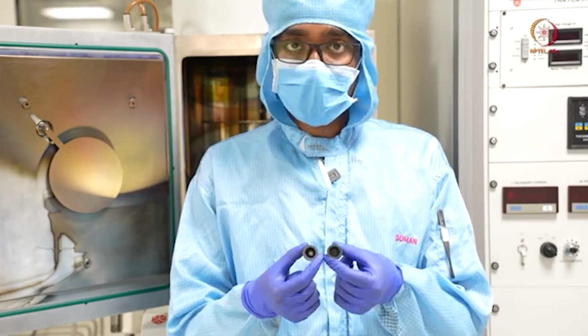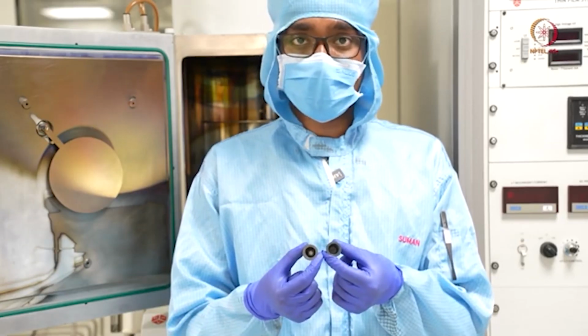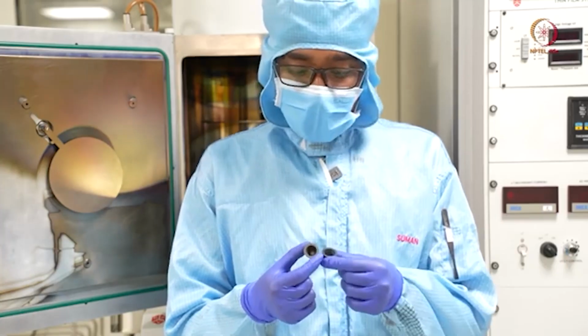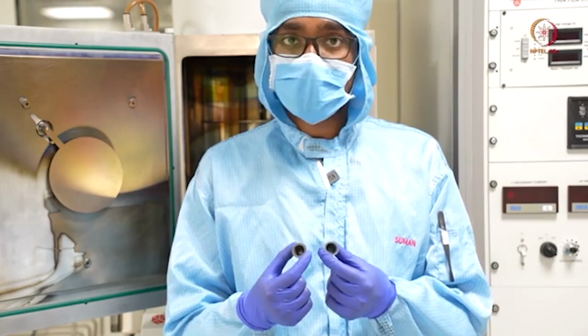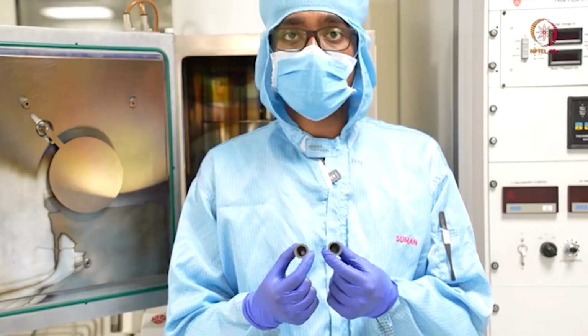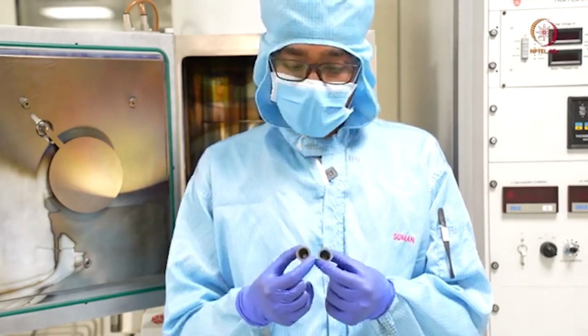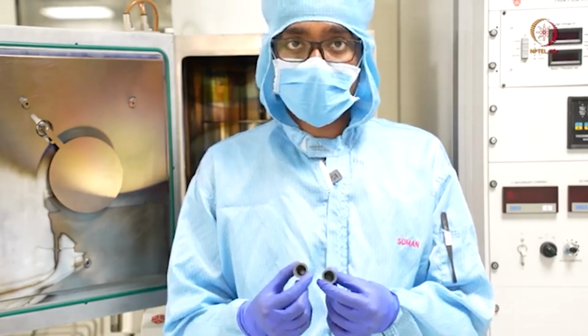Though from a far look it may be of similar color, it is not the same material. Before loading any crucible, you should wash it and clean it once with solvents like acetone and IPA, and then put the material here and load it.